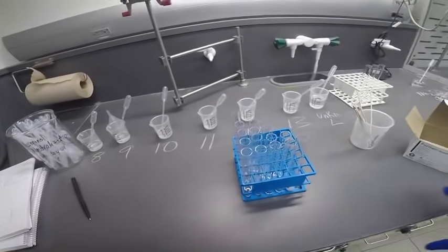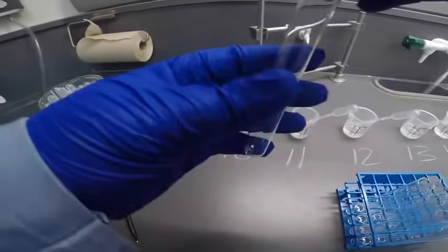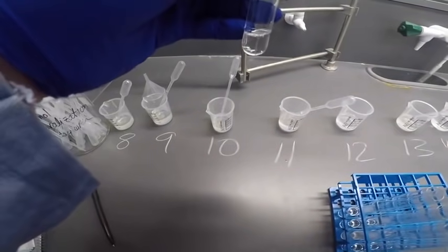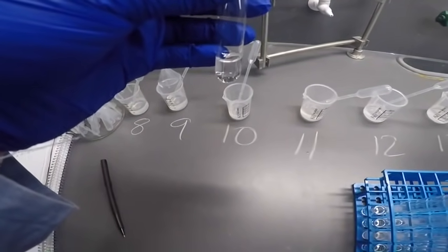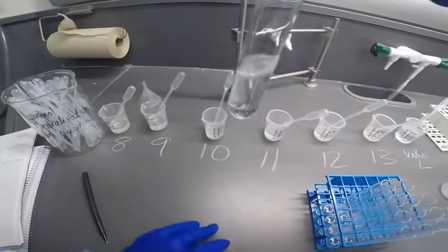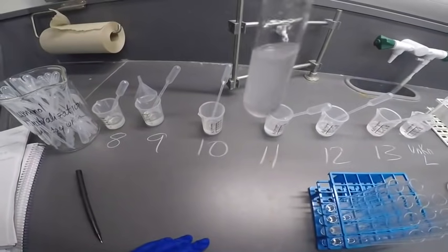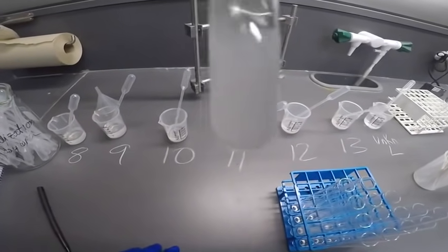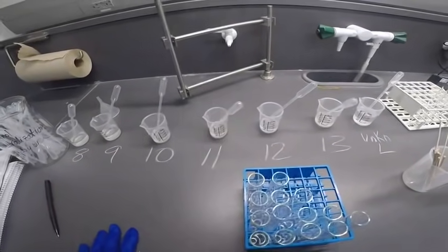All right, and then finally we're going to do 12 and 13. That's our last one here. So 12. I didn't even check the other things for that one, but that's precipitate. It doesn't normally give you more than one. 12 and 13. So I saw a little bit of a disturbance as things mixed together. And there's a bit of a precipitate in there. As I stir it, you get a little bit more. All right, so 12 and 13 give a precipitate.